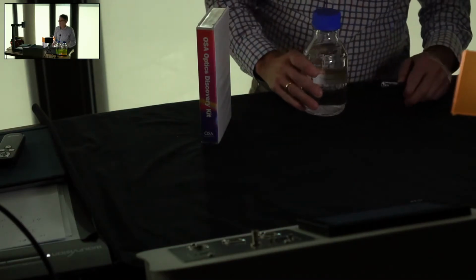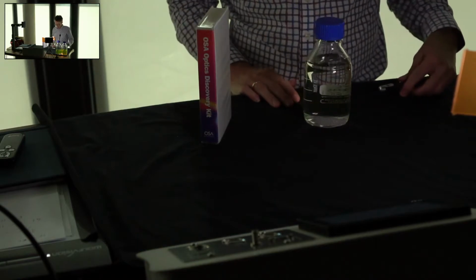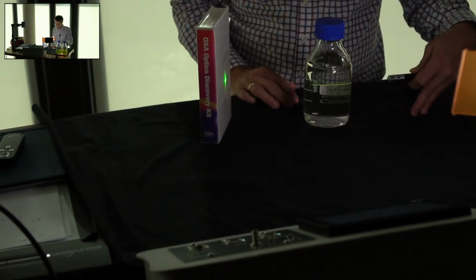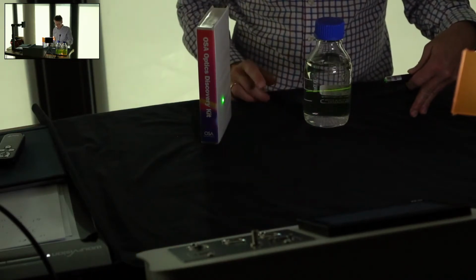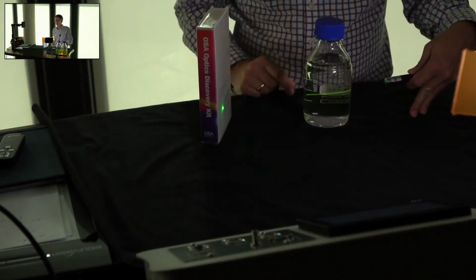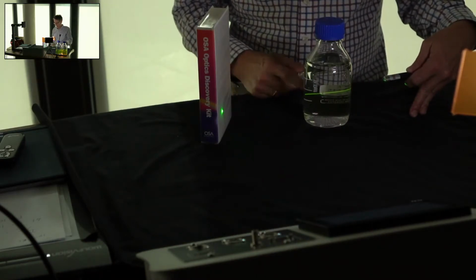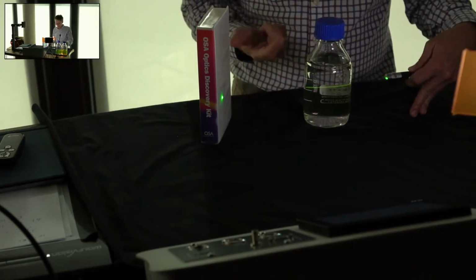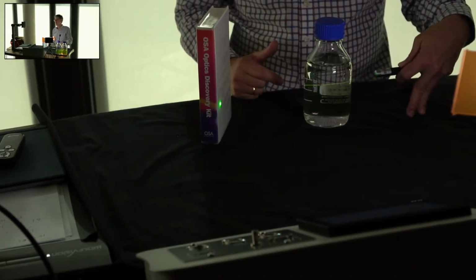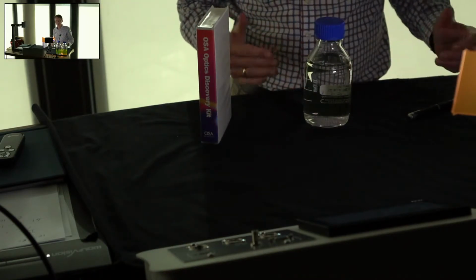What about this? Same thing again. This looks exactly the same as water. Let's put the laser beam on, and look at this. The beam passes through, of course, without any absorption, but in fact this contains a very dilute concentration of rhodamine 6G. Again, the solution is far too dilute for you to measure this in absorption, but the fluorescent signal is extremely strong. And the reason is that we have the fluorescence appearing on a zero background.